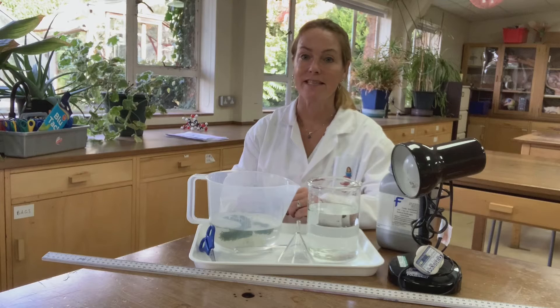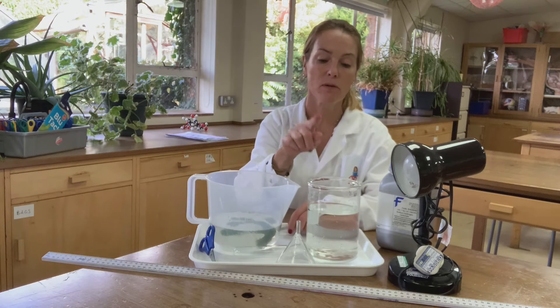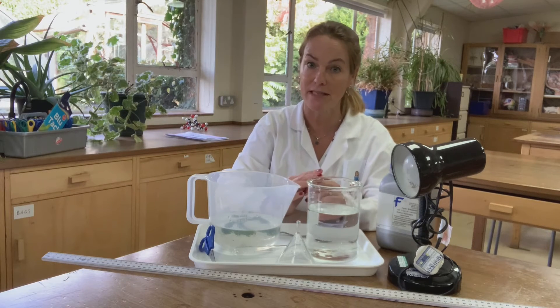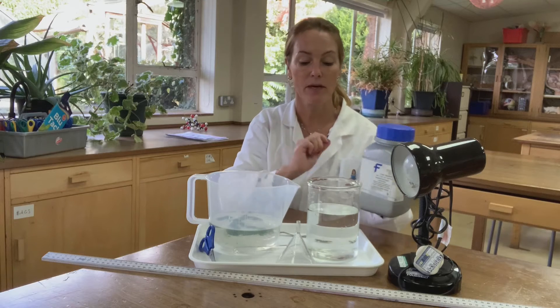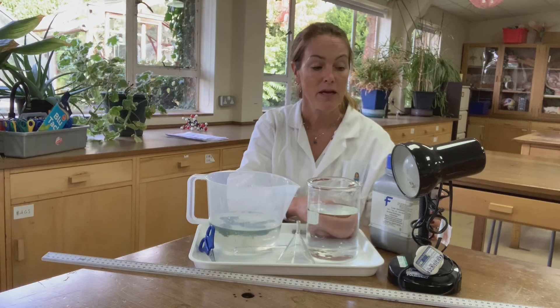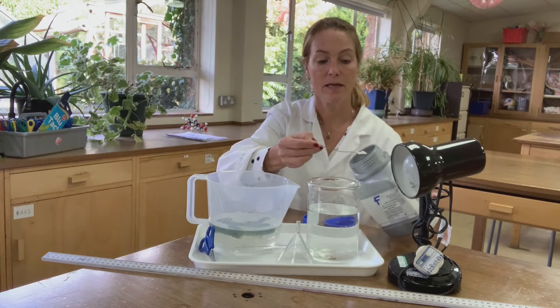In this experiment we're going to look at how light intensity affects the rate of photosynthesis using our pond weed. We have pond weed in a large beaker of water, a glass funnel, a boiling tube, a light to change the light intensity, and a meter rule to measure how far the light is from the pond weed. We also have sodium hydrogen carbonate — we're going to put one spatula full into the water to ensure there is enough carbon dioxide for photosynthesis, so that it's just light intensity that is changing the rate of photosynthesis.